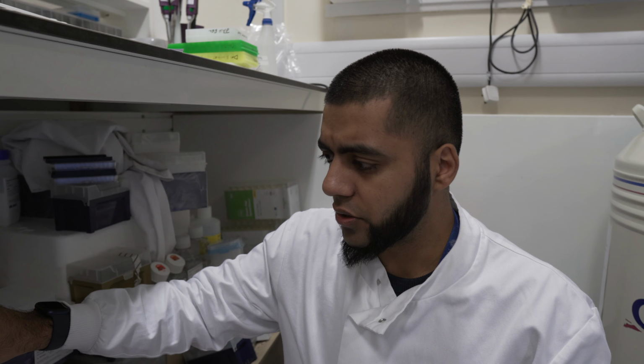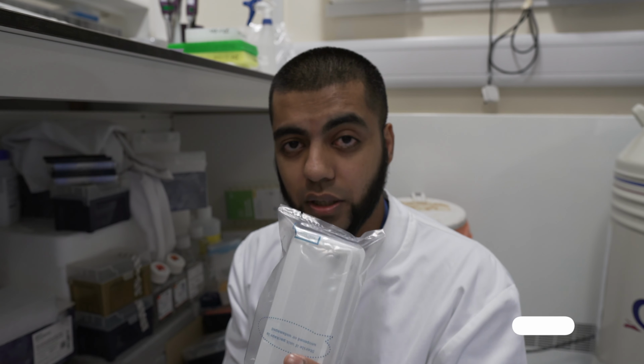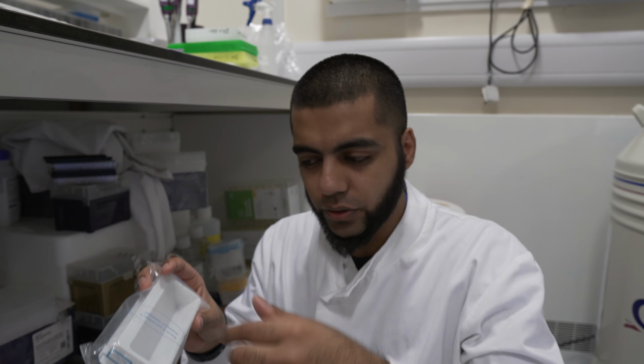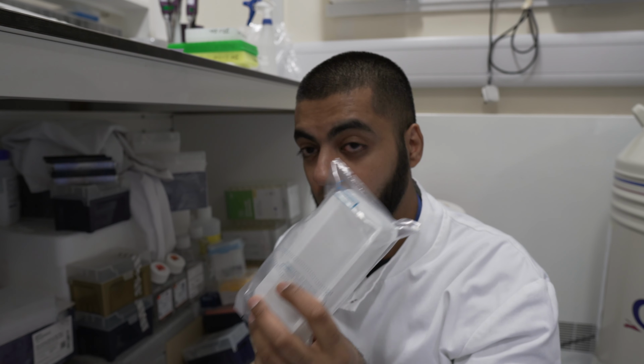And the reason why I mentioned going back to this is these are really, really handy if you're doing any multi-channel work, which I do quite a lot of in this job. And these are really helpful. You've got buffers or solutions, dip in your multi-channel, and then you can make your life a lot easier.